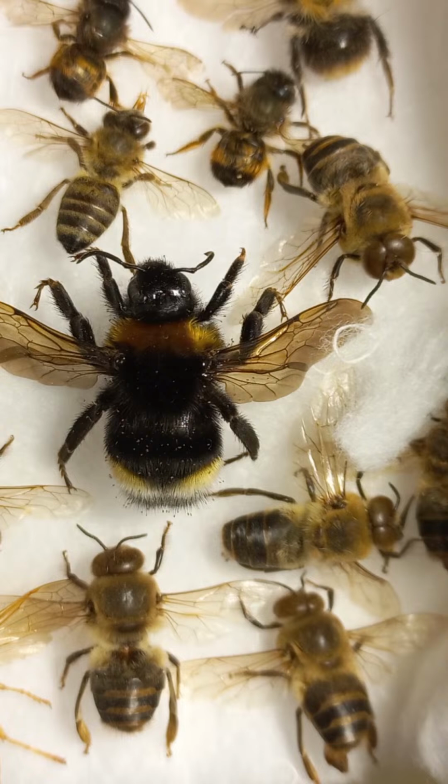Insect blood is hemolymph. Honeybee wings have distinctive patterns composed of only 4 major veins. This is much less than for most other insects, such as dragonflies, for example.